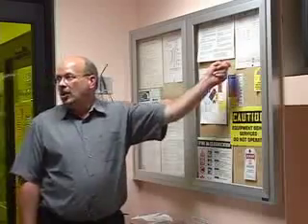If you feel that there's an issue with X-rays, you should talk to the OSHA representative and get a personal dosimeter that you could wear when you operate this equipment, and it would detect any exposure to X-rays. I wore one initially when I came here because I was involved with a lot of this equipment, and after a couple of years I finally just discarded it. But we do want you to know that this is a possible hazard in our laboratory.